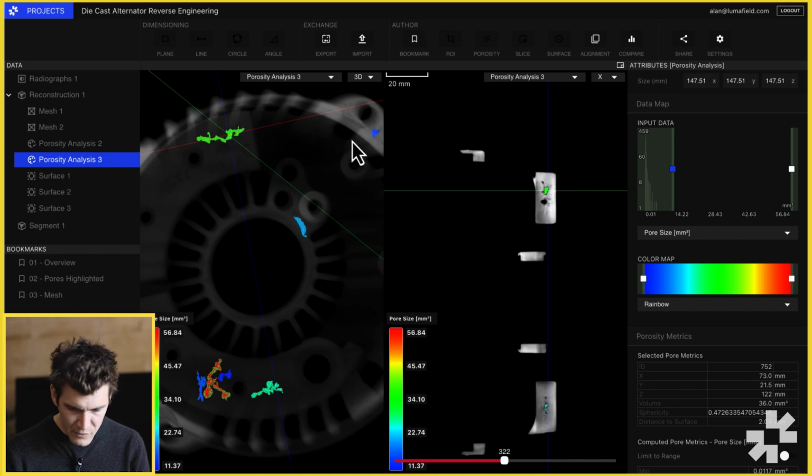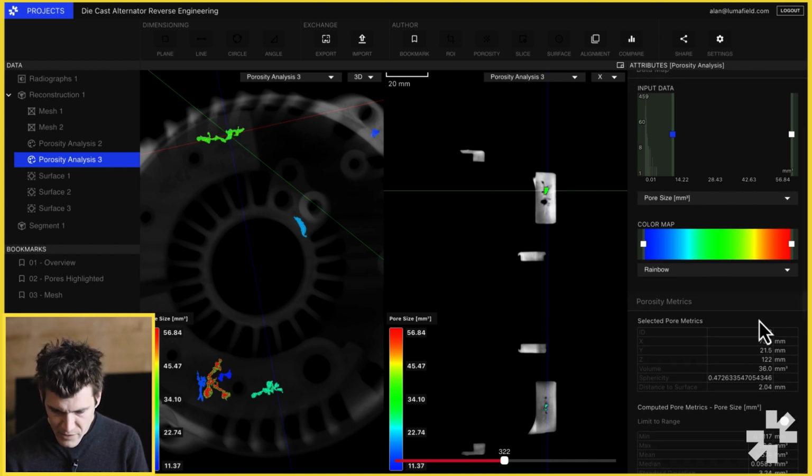By selecting an individual void, we can snap to it in both 2D and 3D and read out its individual porosity metrics. In addition to pore volume, we also calculate sphericity. Sphericity is a measure of how round or how spherical a pore is. So a sphericity value of 1 means that we have a perfectly spherical pore, and a sphericity value of anything less than 1 indicates that that pore has some aspect ratio, either in 1 dimension, so a very long skinny pore, or in 2 dimensions, something that's flatter like a pancake.